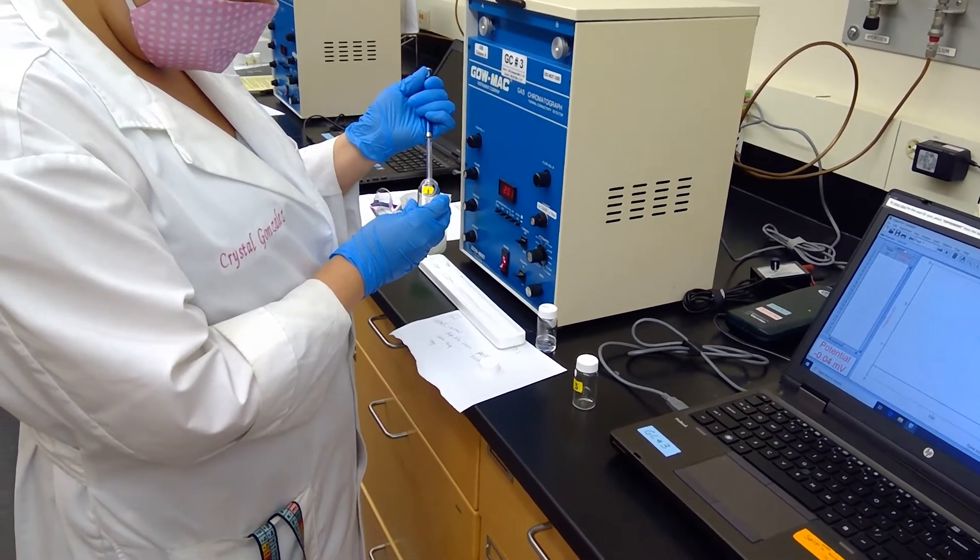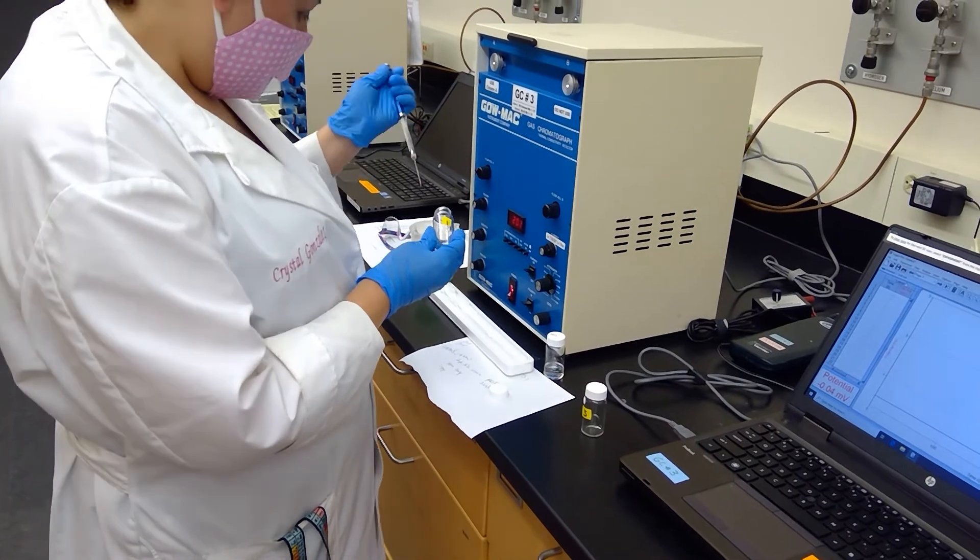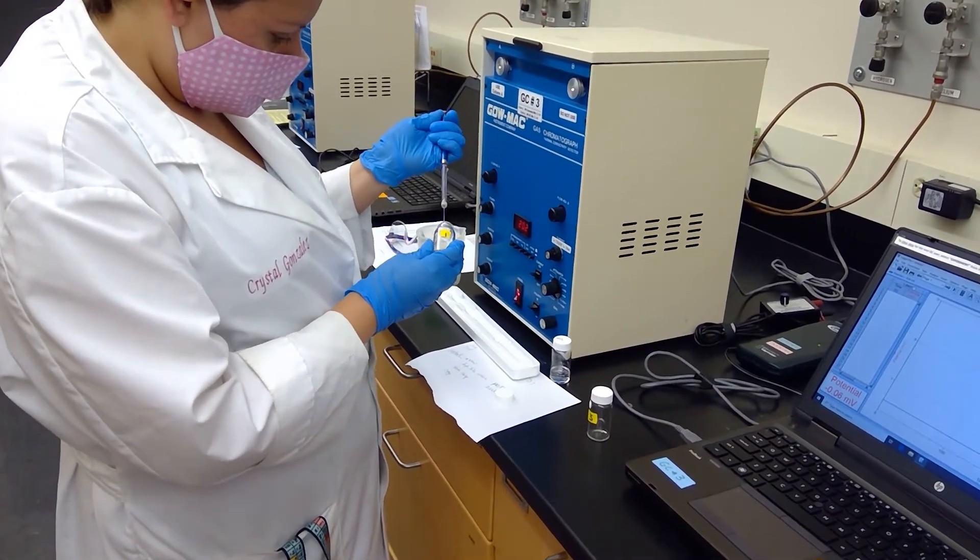This is ensuring that my syringe has only the compound that I want to analyze. So it's kind of like washing before you go.